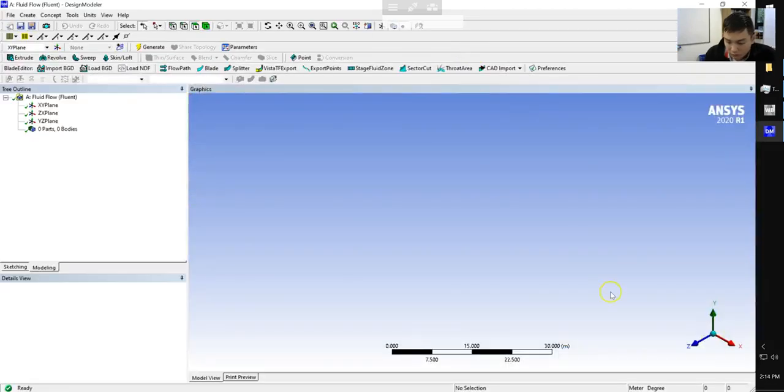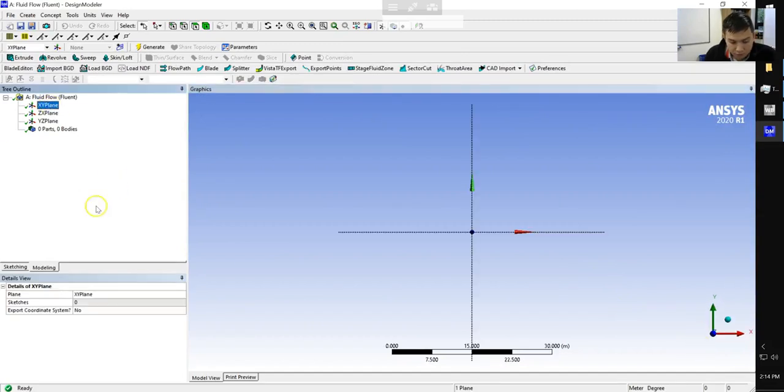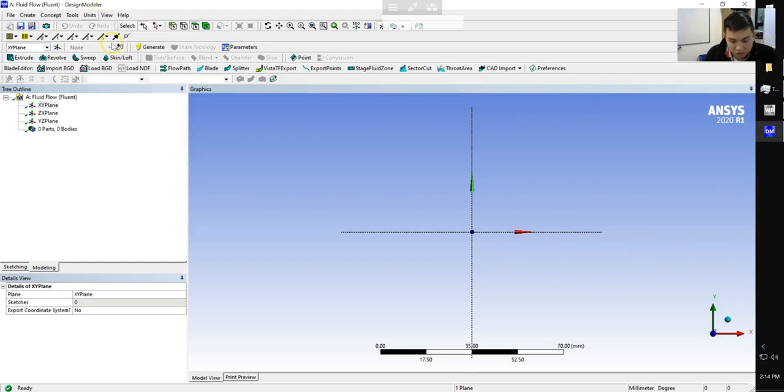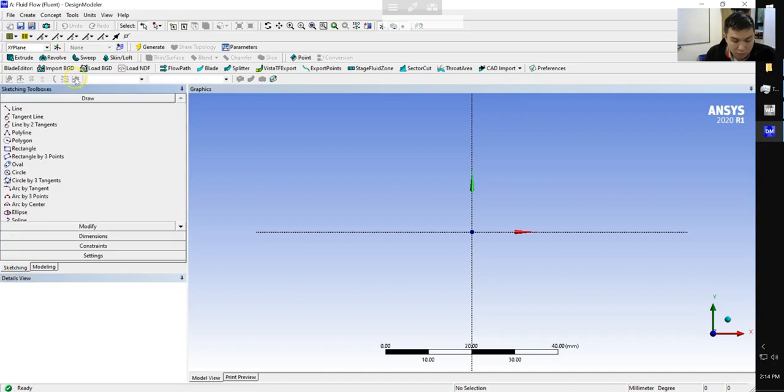Okay, so we have our Design Modeler open. Let's go ahead and look at the XY plane. We're going to zoom in a fair amount, because we're going to build a device that has about a 0.25 millimeter cross section. So we're going to change our units to millimeters instead of meters. So 25 millimeters, you can see down here, that's roughly a scale bar. So we're reasonably zoomed in.